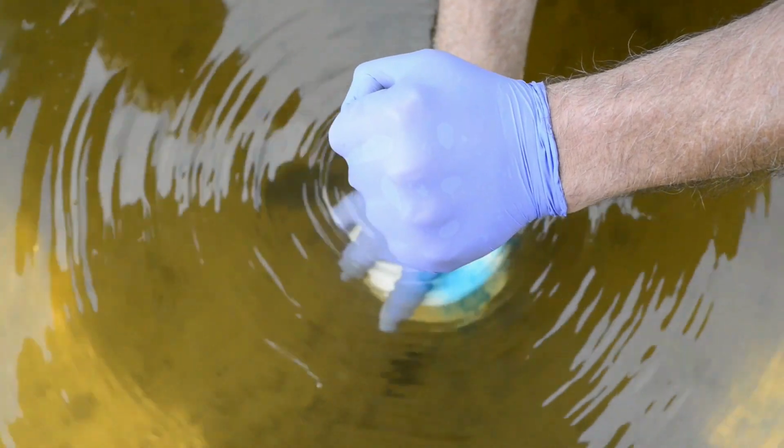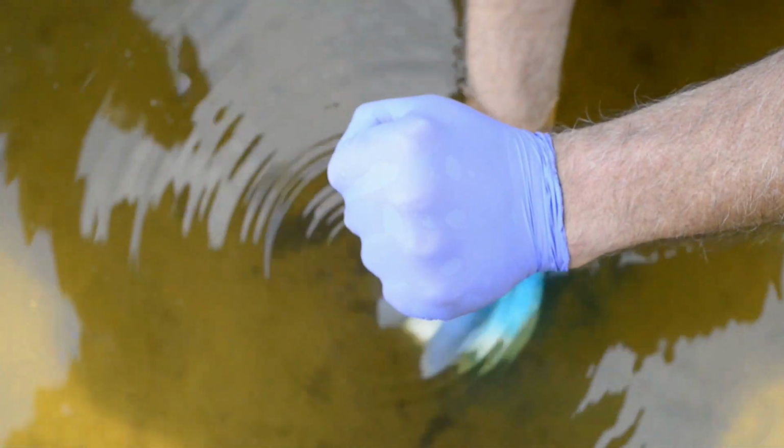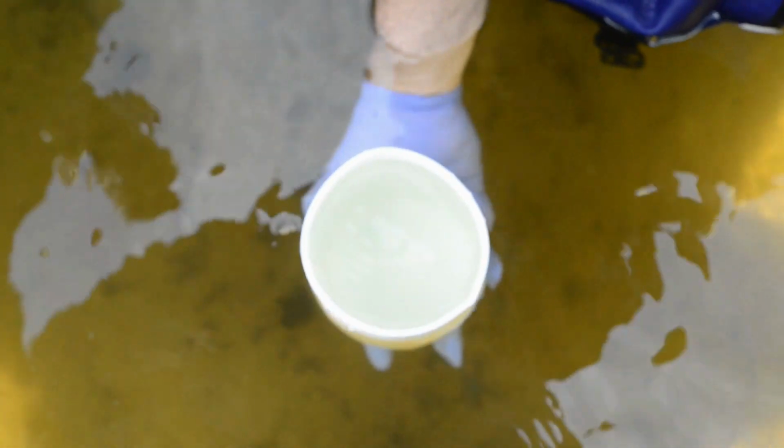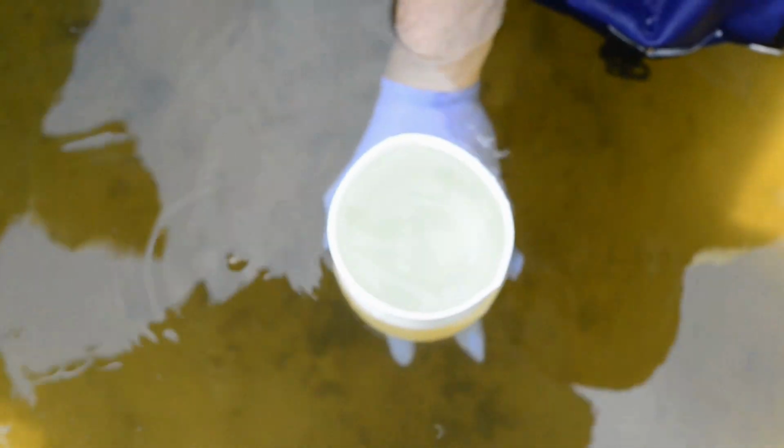And you will see that we don't pick up any dye because we come up through the bubble. So there's plenty of dye there. I come up through the bubble. And then you can see that water is the same water as in the thing. We don't have any blue in there. So we didn't pick up any dye. The bubble actually disperses the dye and moves it out in 360 degrees.